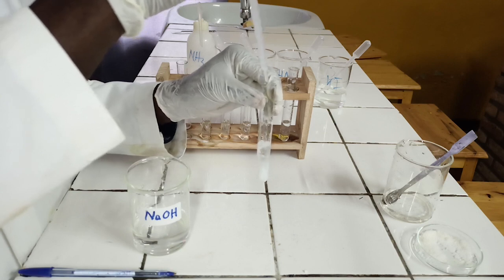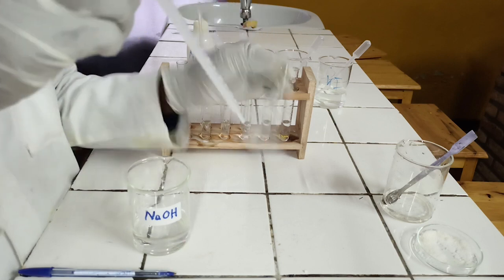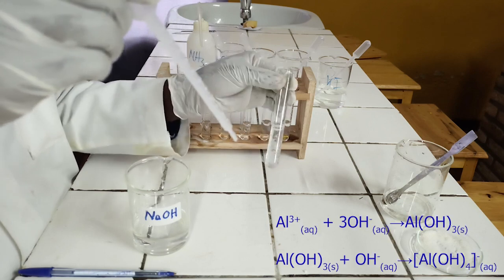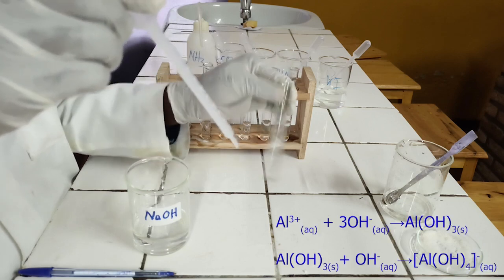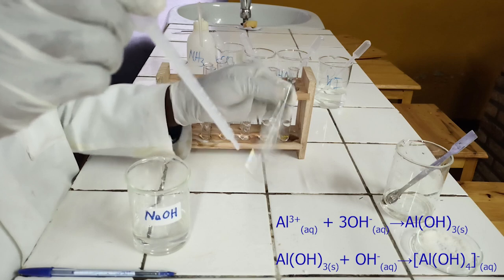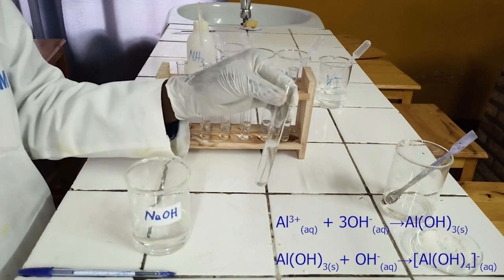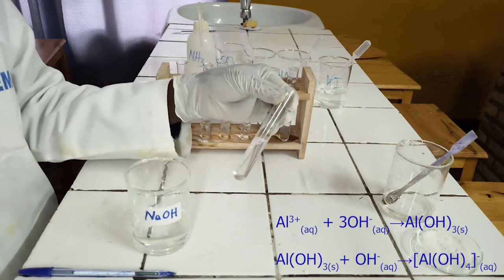As you see, sodium hydroxide reacts with aluminium ion to form white precipitate, which is soluble in excess of sodium hydroxide. Below, there is an ionic equation for this reaction.